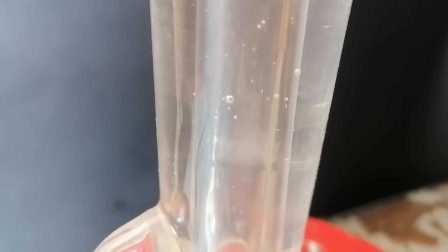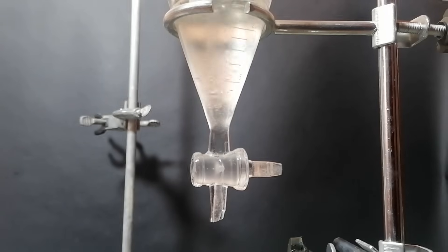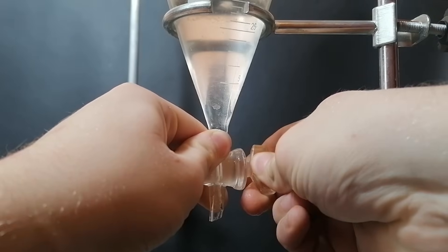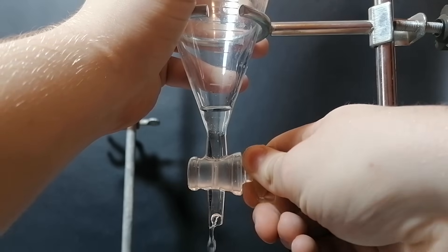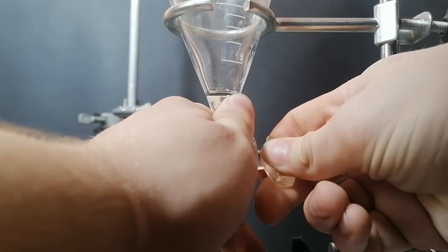Anyway, I've just repeated the whole thing — the same distillation and reflux. This time in the reflux I've used cooling water, and you can see on the video how the vapor travels inside the condenser. All of that white stuff is literally all of the vapors from the reaction getting cooled back down into a liquid. The whole mixture from the boiling flask was added into a separatory funnel, and on top there is a small layer — this is the isoamyl acetate layer, and I can already smell a strange, strong, fruity smell. I decanted the lower water layer very slowly because the organic layer is extremely small, and once most of the water layer was decanted, a very small line appeared where the isoamyl acetate is separated.